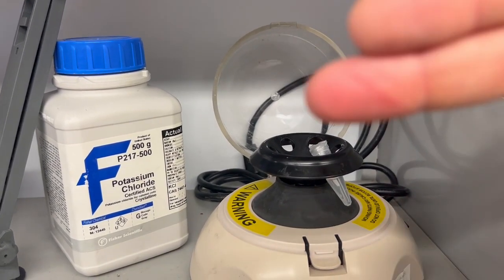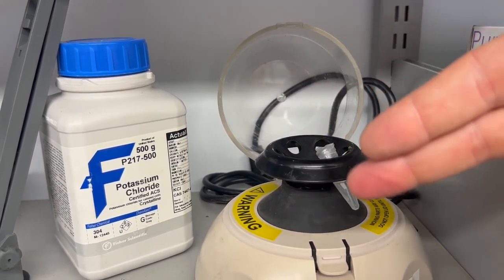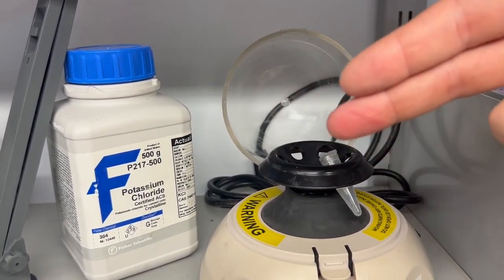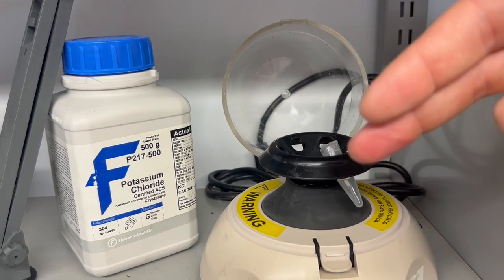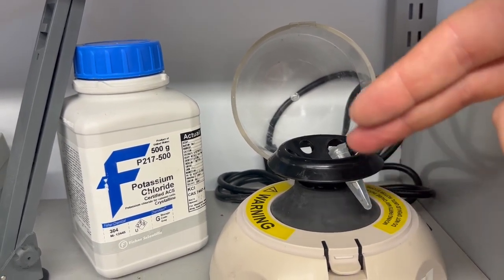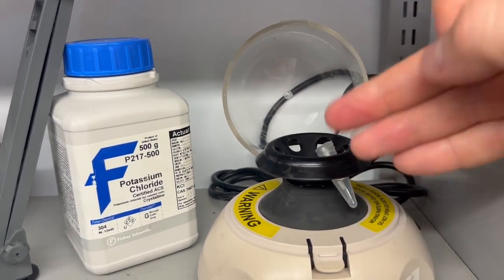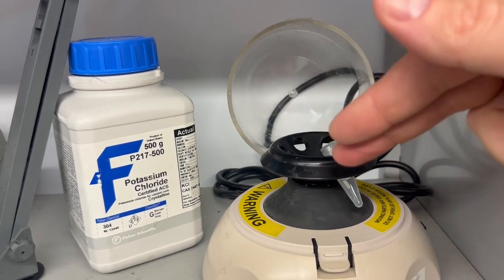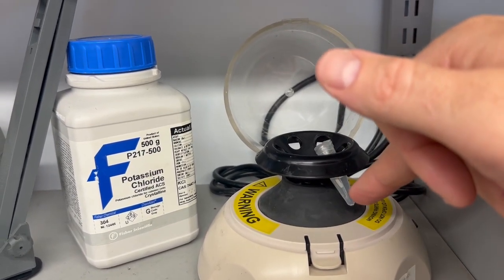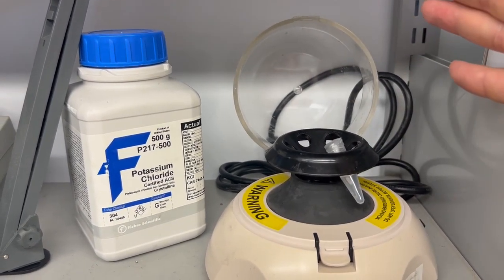Then you would resuspend the pellet, adding the liquid that you want, mix it around, and then you centrifuge it again, concentrating the pellet. Then you remove the excess liquid, keeping the pellet in place, and then you add the liquid that you want again. Do it 3 times. After that third suspension, you feel confident that the particles you have are suspended in the liquid media conductivity that you created.